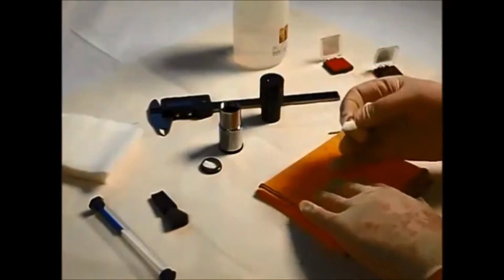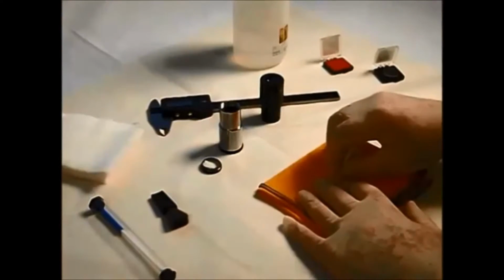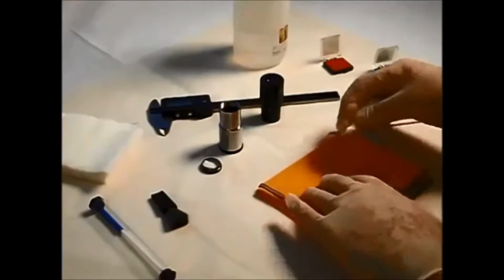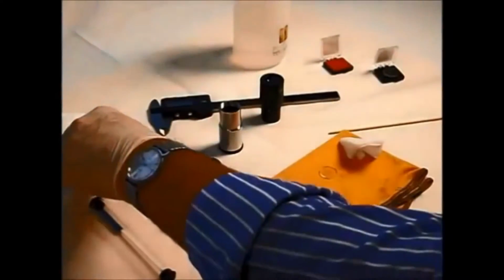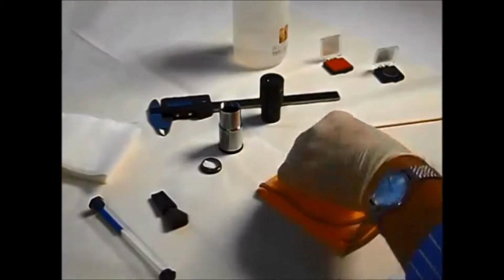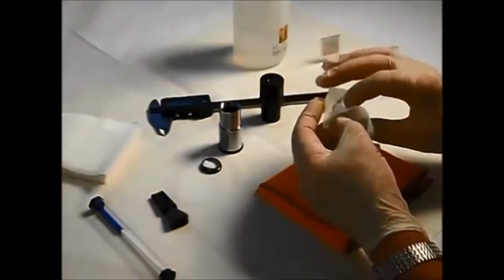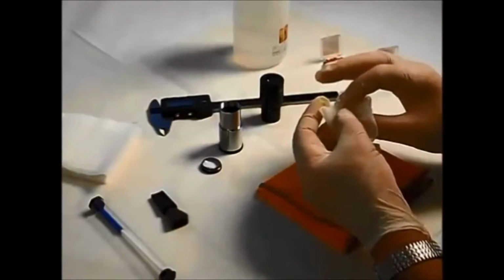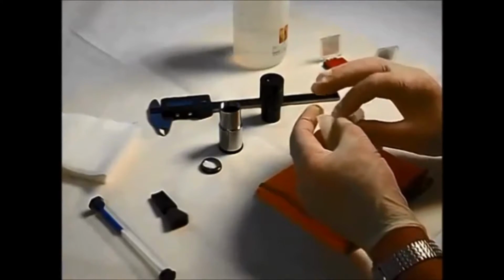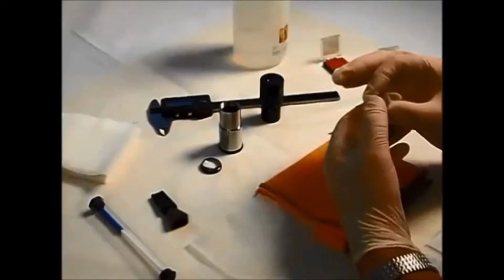Now similarly, you do this on the reverse side. Move to the outside edge. Finally, just give that a bit of a clean polish and dry, like this. It's important to make sure it's dried properly, otherwise if the fluid dries wet on the glass you get a sort of watermark or cleaning fluid mark on there. We don't need that.